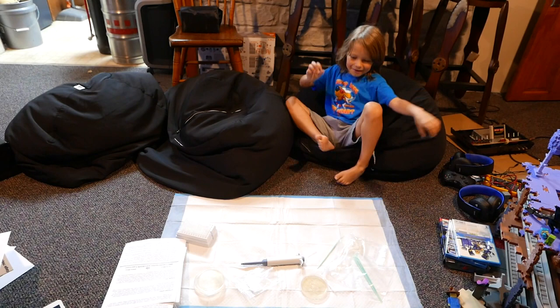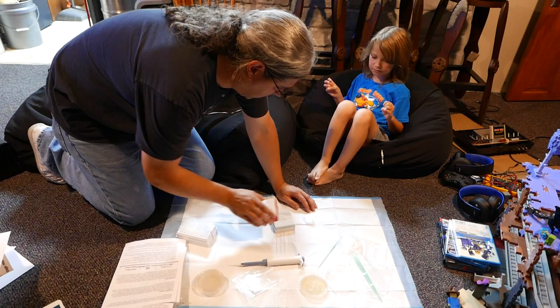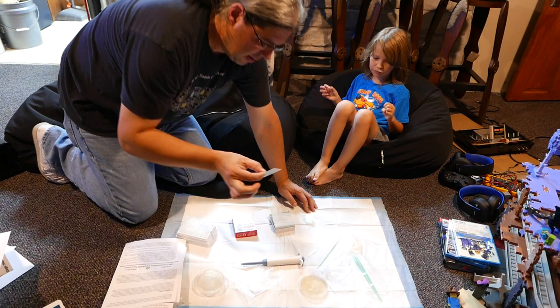No, no, no — what are you doing? That's too heavy, you can't move that. Oh, you're going to take the camera. Well, let's get the slide ready first, right? You want to do this or do you want me to do it? You can do it. Alright, good. I will put it on there.